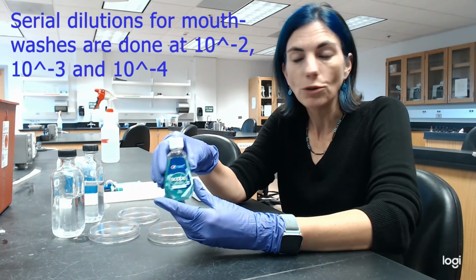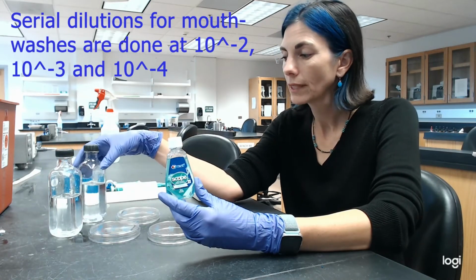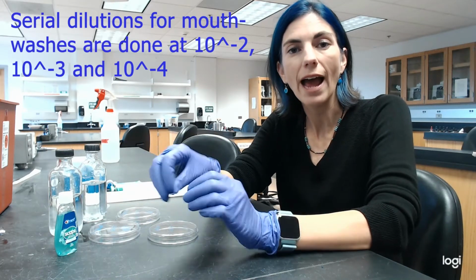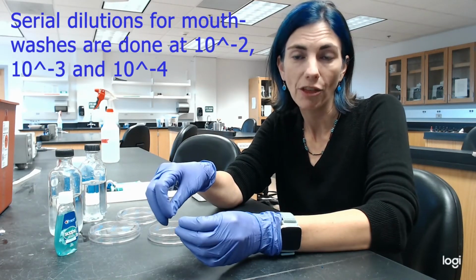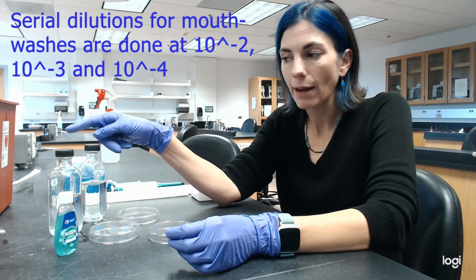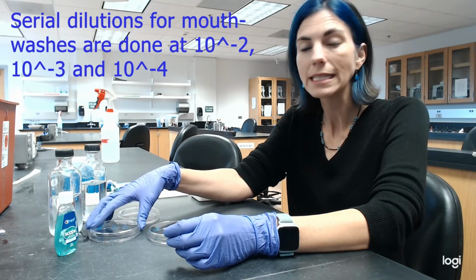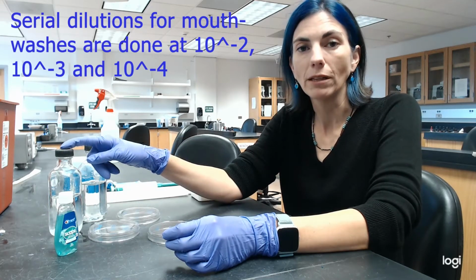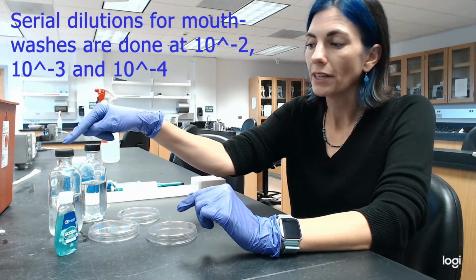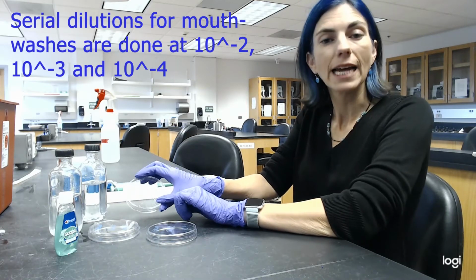So I'm going to use just two bottles, a bottle A and a bottle B, like so. I'm going to take my mixture of scope and saliva after it's sat for 30 seconds, and I'm going to pipette 1 ml into bottle A. And then I'm going to take 1 ml from bottle A and actually put it on a 10 to the minus 2 plate. I'll take 0.1 ml from bottle A, and that will be a 10 to the minus 3 dilution. I'll take 1 ml from bottle A to bottle B, and then again 1 ml from bottle B to make a 10 to the minus 4.